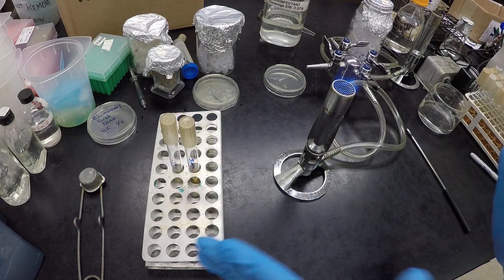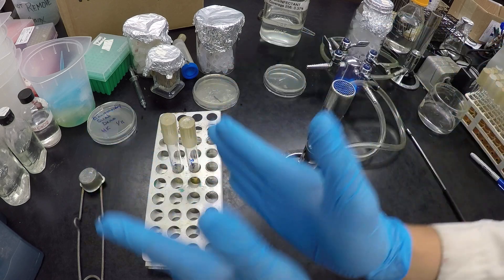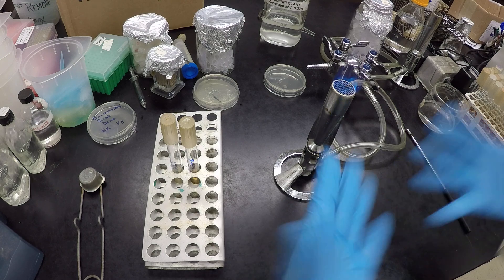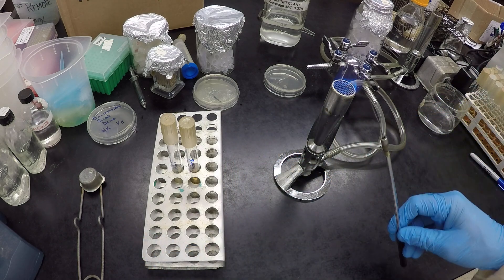Keeping in mind some of the principles we learned about aseptic technique: open only when necessary, work near the flame, make sure that the bench has been cleaned, make sure that we are clean, make sure that our tools are sterile.